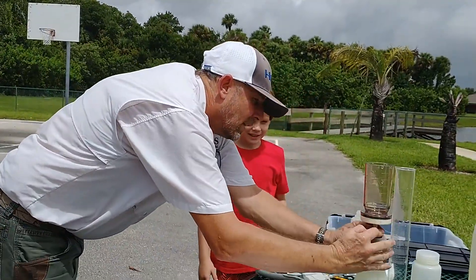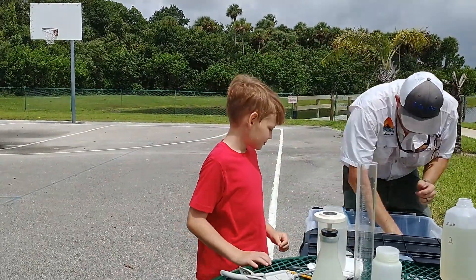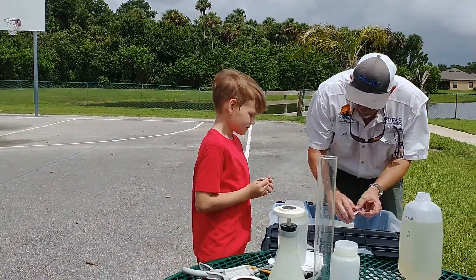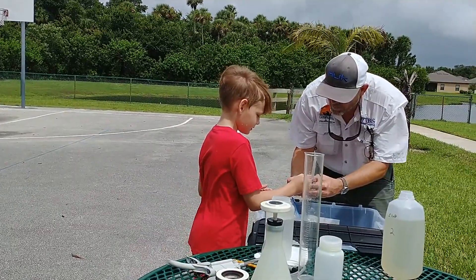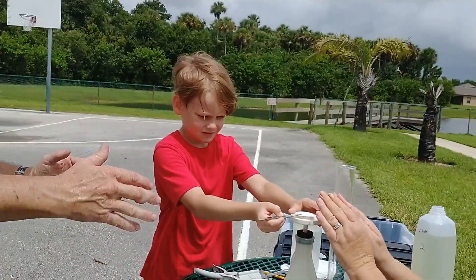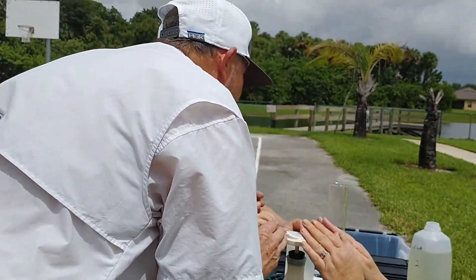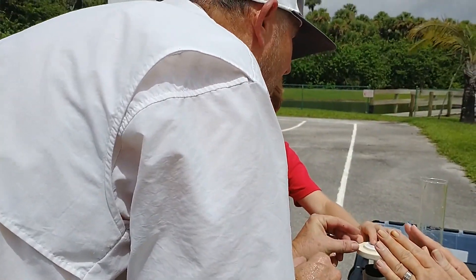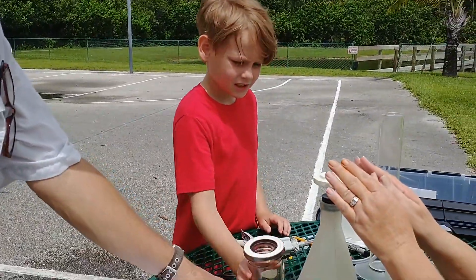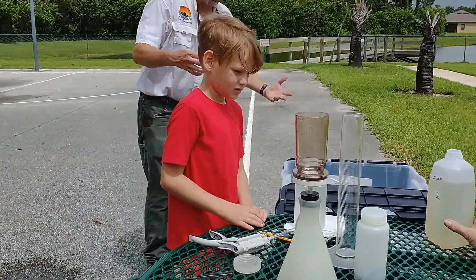Now let's try it again. Before you put it on this time, I'm going to put my hand around it so the wind won't move it. We're just having a windy day. You got one? There you go, you got it. Hold on one second before you let go. Flip it — there you go. You probably just helped yourself by getting it wet. Take that, put it on there.